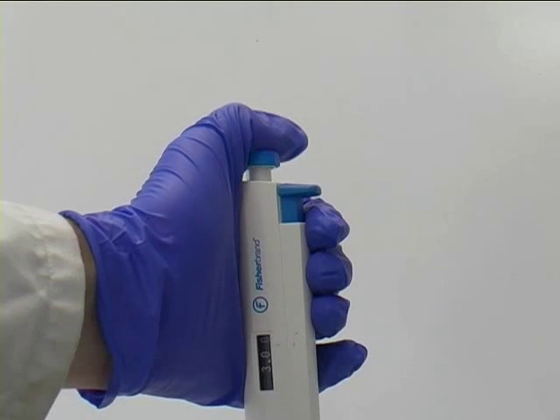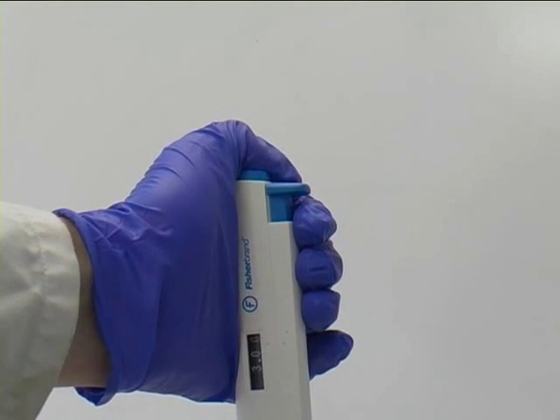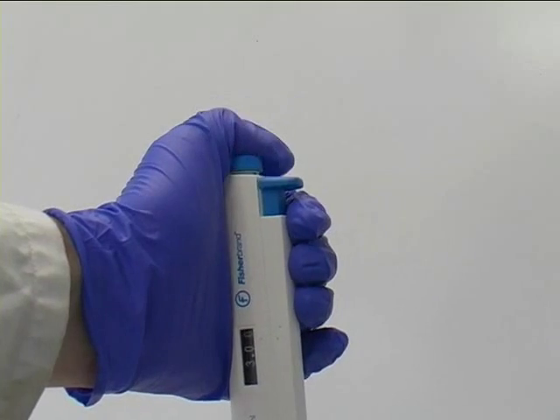Auto pipettes are double stop, that is if you push down the button on the top there is a first resistance which can be pushed through to a second stop.